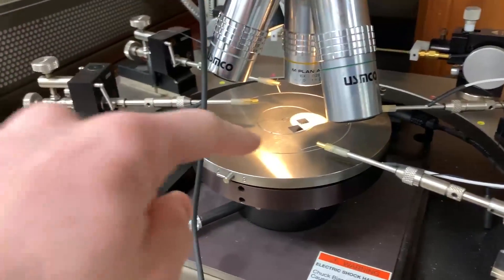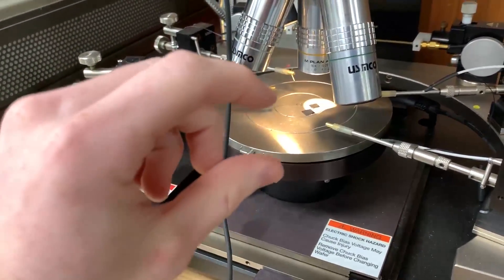So before I go into how it actually works I'll just give you a quick demo. I've got it set up with a one centimeter square of silicon that I've coated with about a 750 nanometer layer of photoresist.